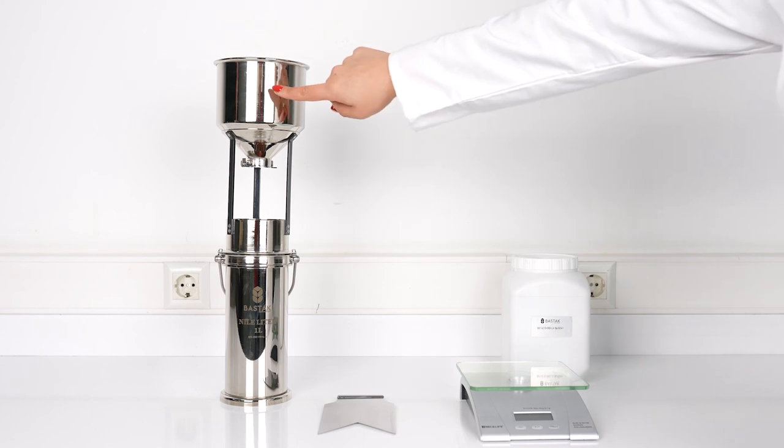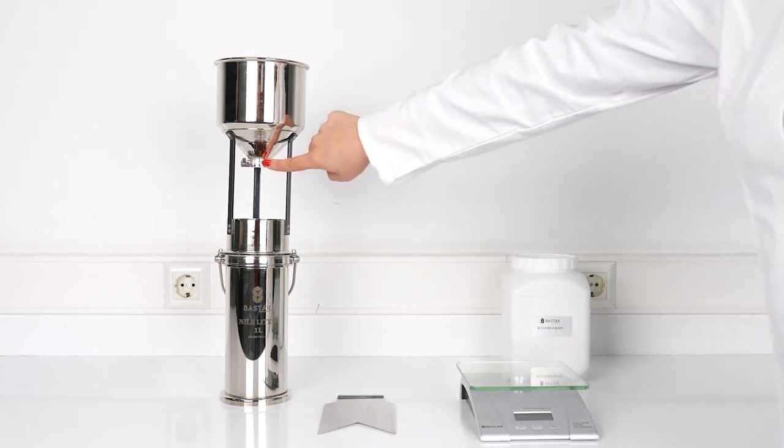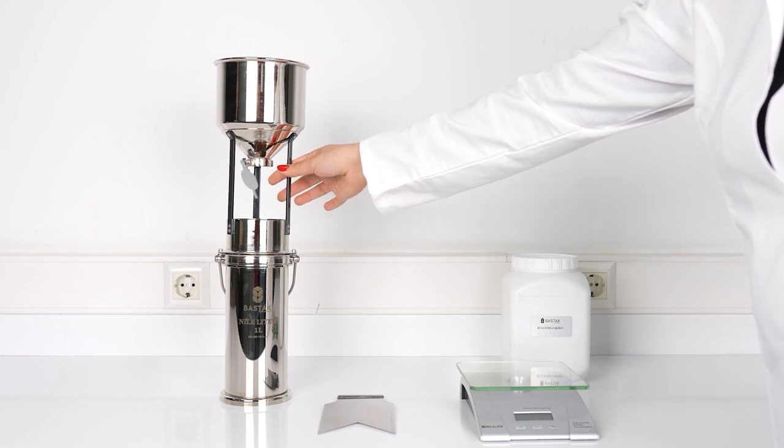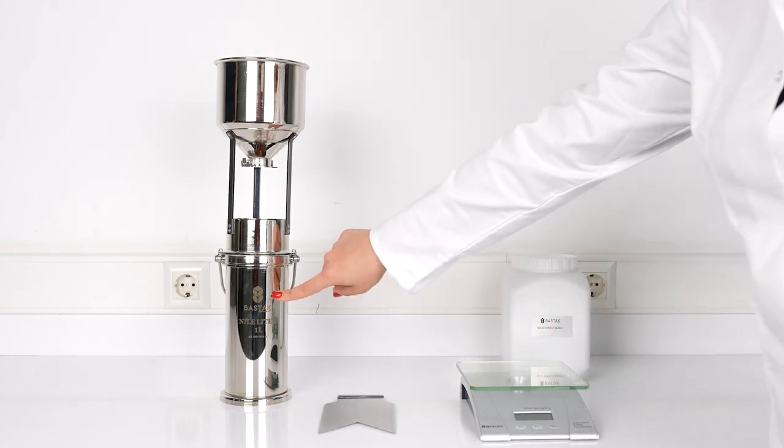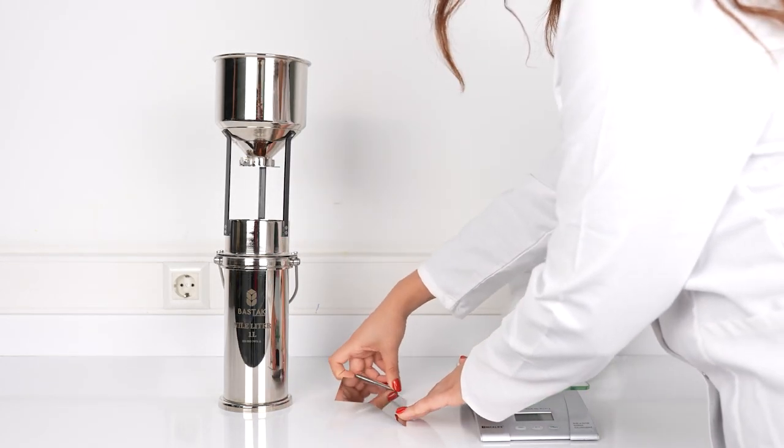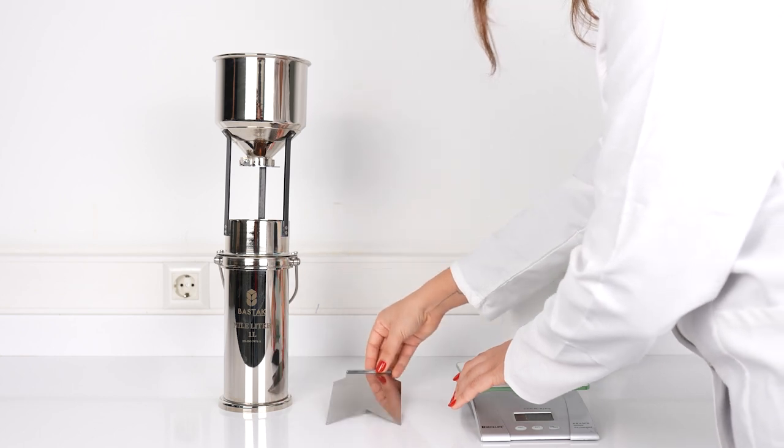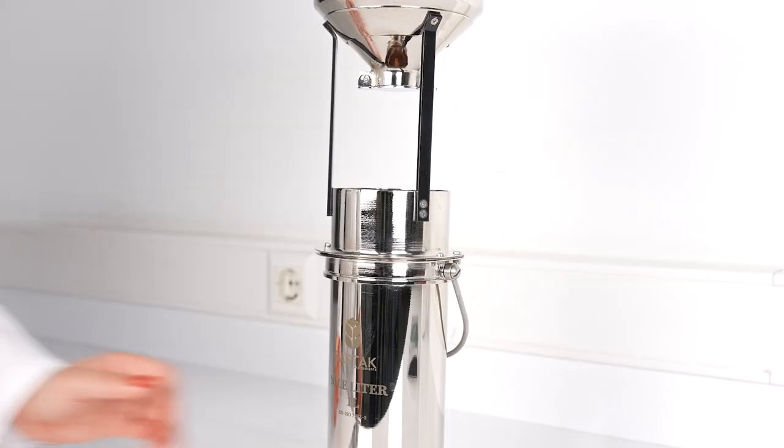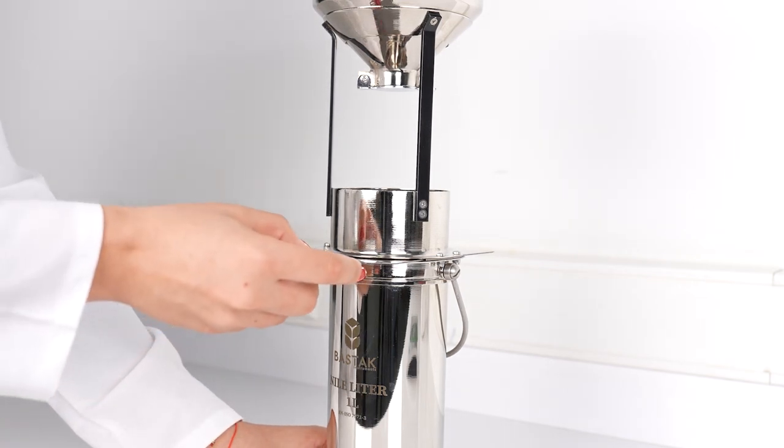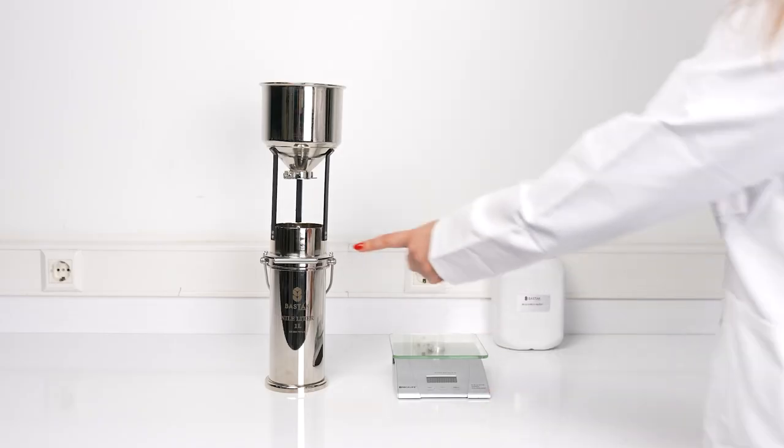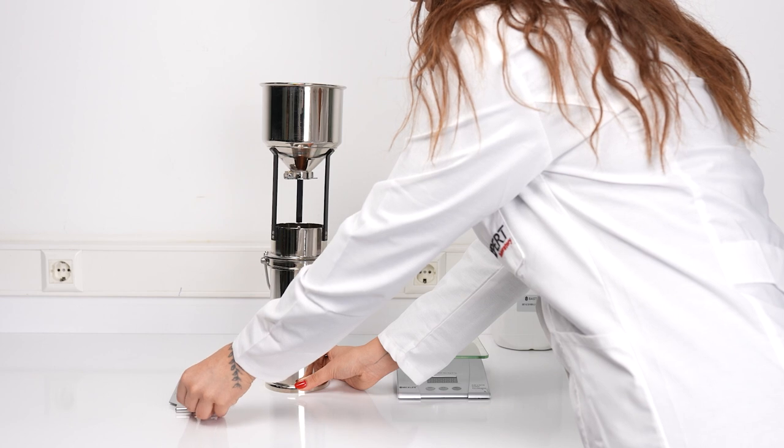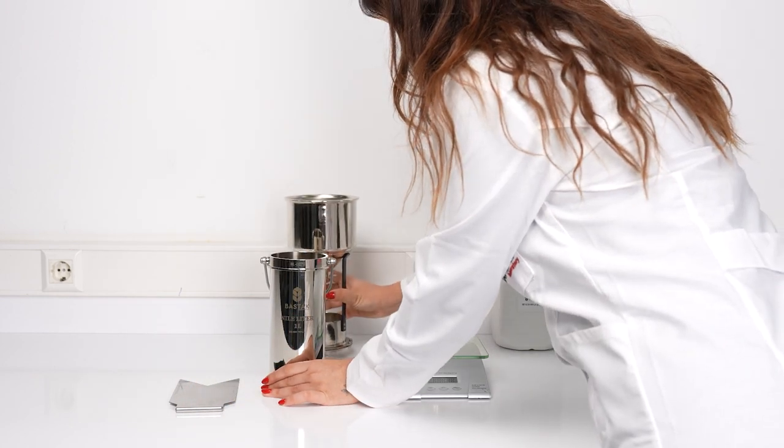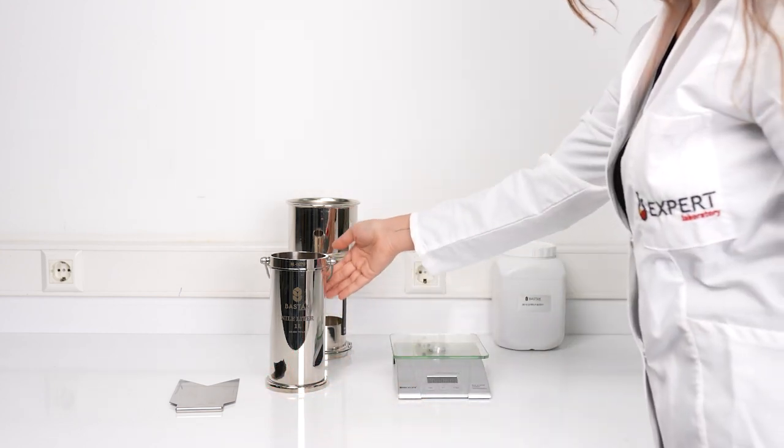Sample placement container: the container into which the sample is emptied during measurement. Transfer device: during the test, the transfer device is opened and the sample is poured into the measurement container. Measurement container: the container where the measurement of the sample to be tested is conducted. Knife: knife used to separate the measurement container from the transfer container during measurement and analysis procedure.